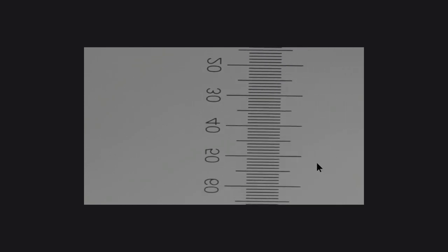Since we have found a crossbar at the equator of the circle, we move the stage only in the x direction towards the center. Some final camera rotation may be needed to straighten the image of the scale.